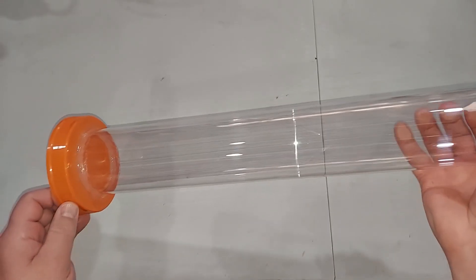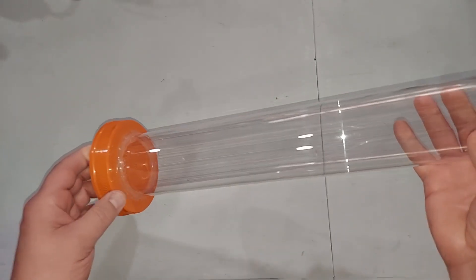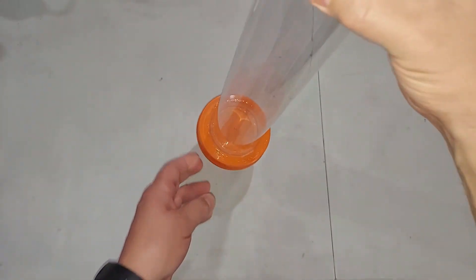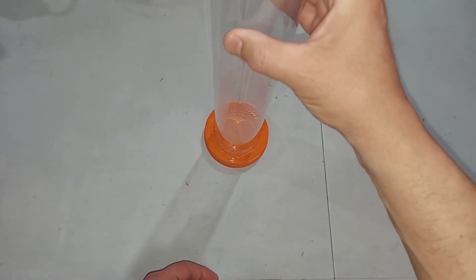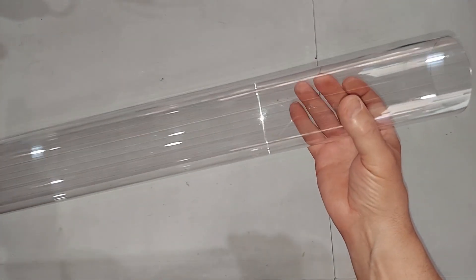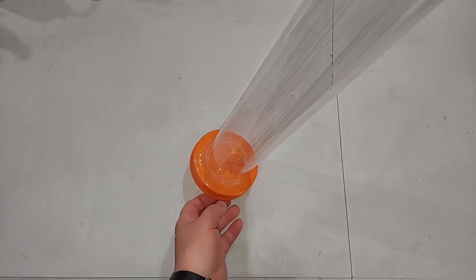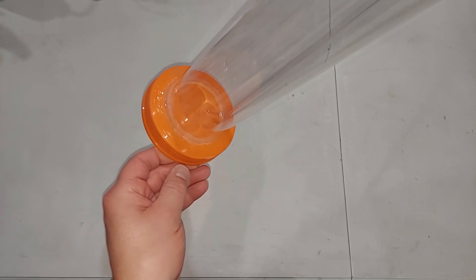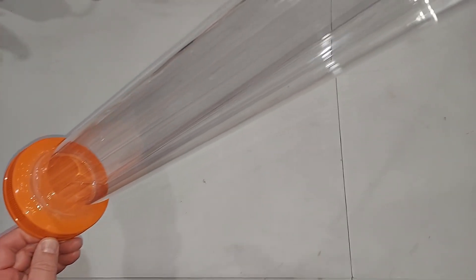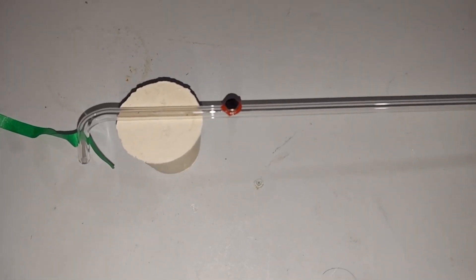This is the cylinder I'll be using to put the water in and then eventually the calcium carbide. I used the top of another container with silicone glue at the bottom — it's two feet tall and made of polycarbonate, which is tough stuff. It would be best to have borosilicate 3.3 glass, but this will do just fine. I've inserted the glass tube with the bend that the chlorine gas will be going through, and it's pretty close to center. I need to fasten it to the side somehow so it doesn't move around.